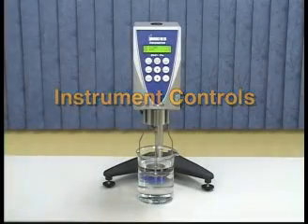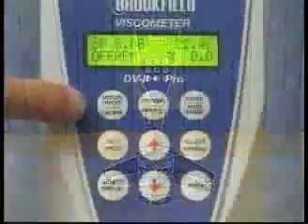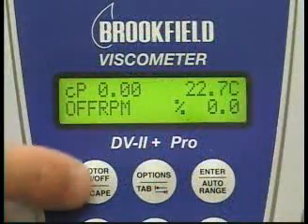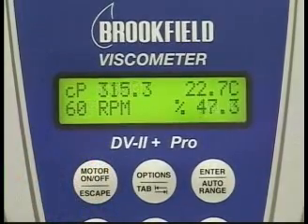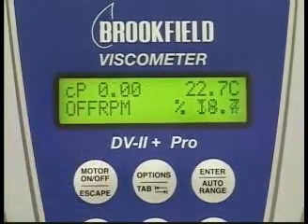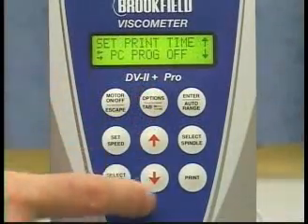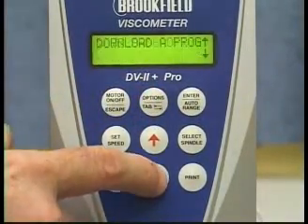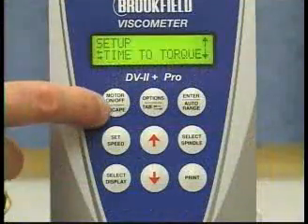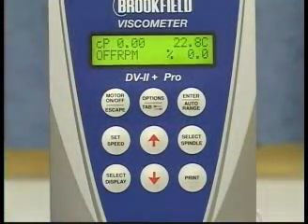Motor on/off escape. The motor on/off escape key turns the instrument's motor on for taking rheological measurements and off when completed. The escape part of this key is used when in the options menu. When making selections in the options menu, the escape key will bring you back one submenu to the main display.